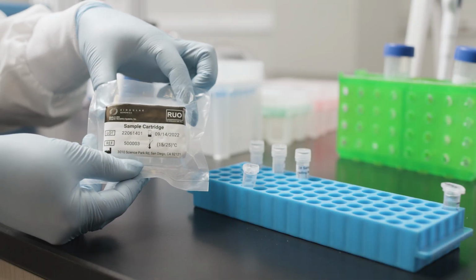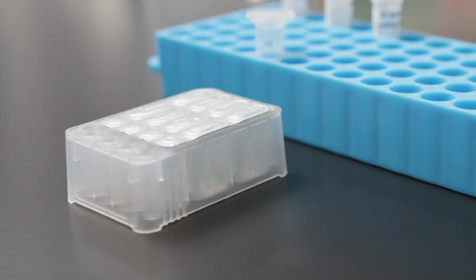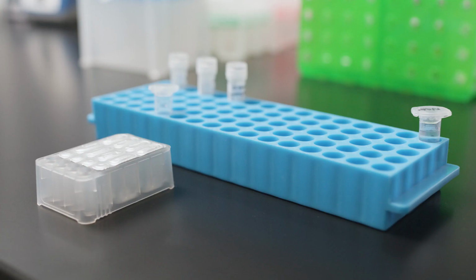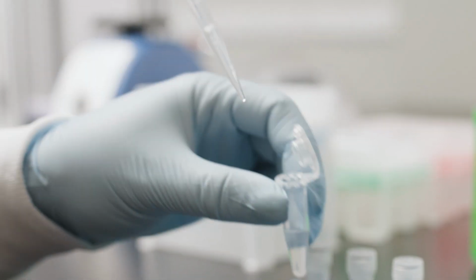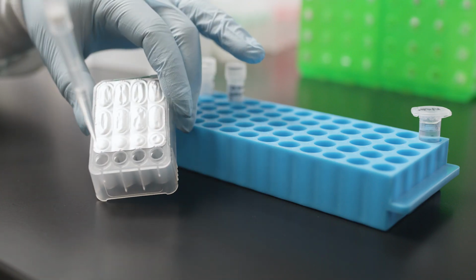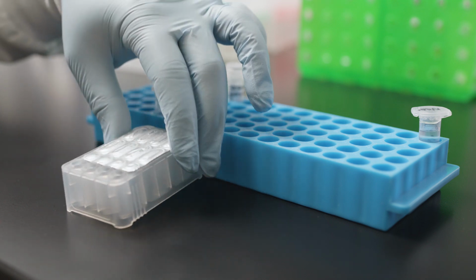Remove the cartridge from its plastic bag. The cartridge has four available sample wells corresponding to each lane of the flow cell. Carefully pipette at least 260 microliters of diluted libraries to the bottom of the designated sample wells, taking care to avoid introduction of bubbles.